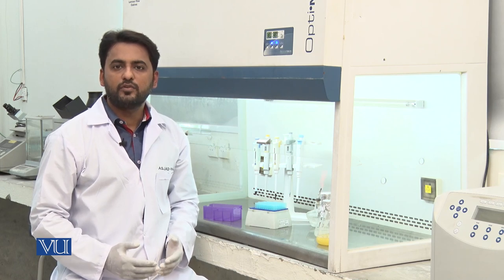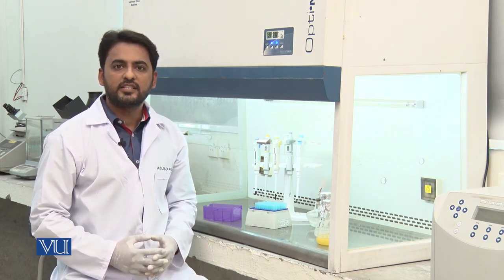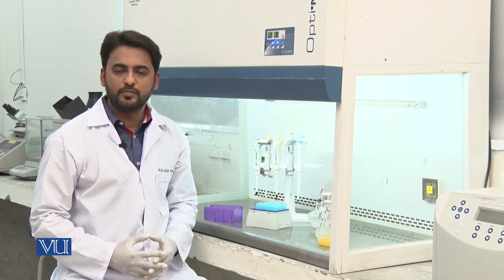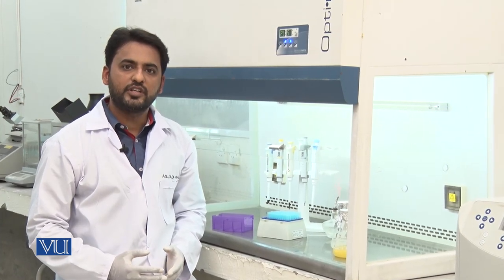Dear students, the experiment which we are going to perform today is regarding the extraction of hydrolytic crude enzymes from microbes. Before we start our experiment, I would like to give you a very brief introduction regarding enzymes. Enzymes are basically globular proteins in nature and they are made up of amino acids. Amino acids are the building blocks of enzymes.